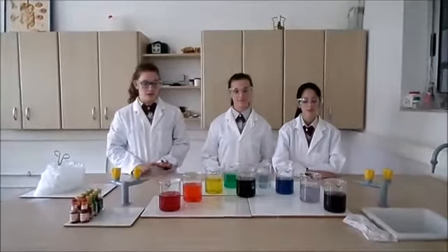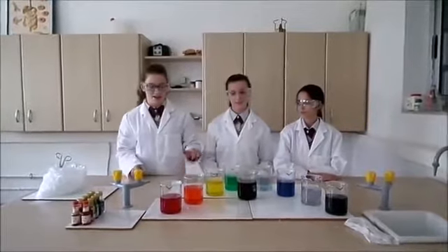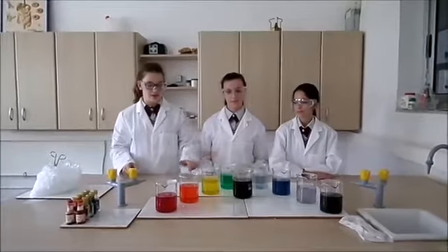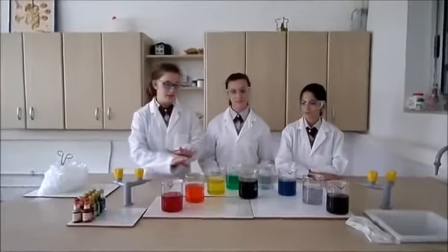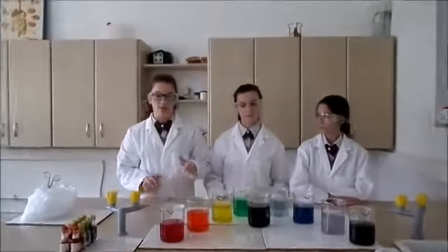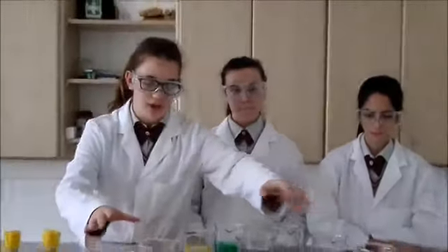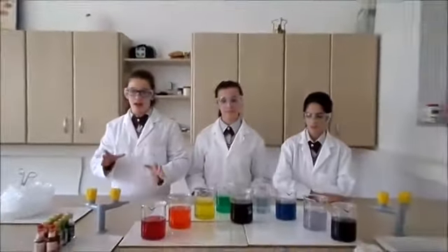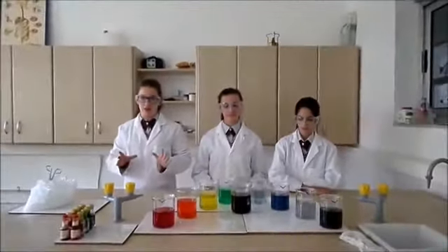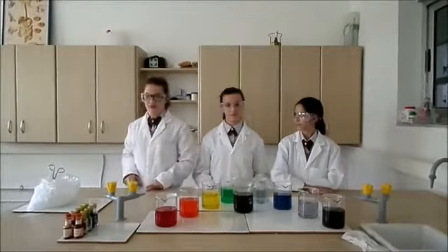So today we are going to do experiments including dry ice and different food colourings. Here we have nine beakers which contain water at room temperature and different food colourings. These four beakers also have soap in them as well, and we will see why, because we are going to do three kinds of experiments.